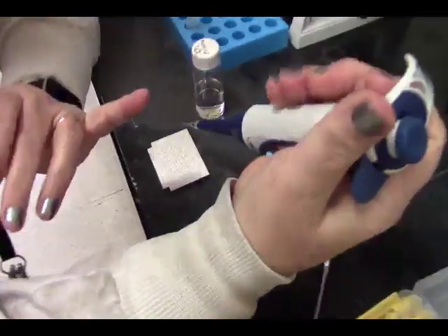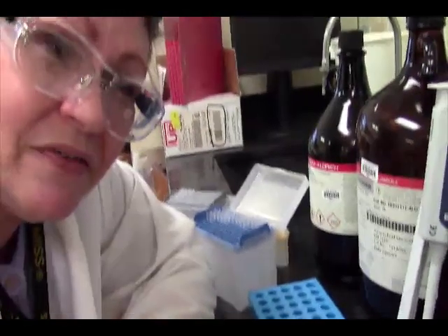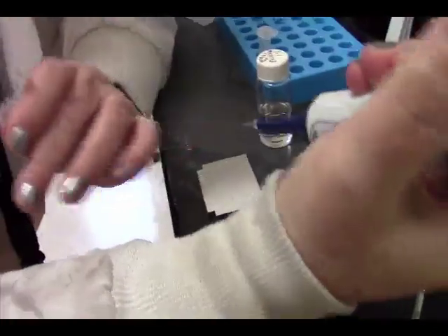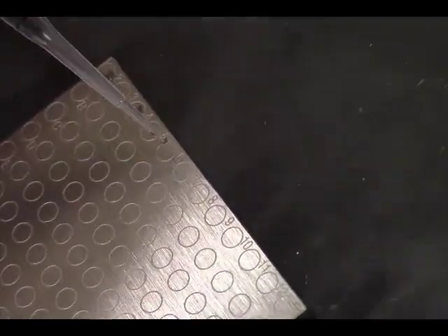All right, now to do this is tricky because sample preparation is 85 to 90% of the quality of spectra that you get out of MALDI. So what you have to do is you just have to barely put that on there without touching the tip to the MALDI plate. Let's do another spot just in case. There's different techniques that you can use for sample preparation.